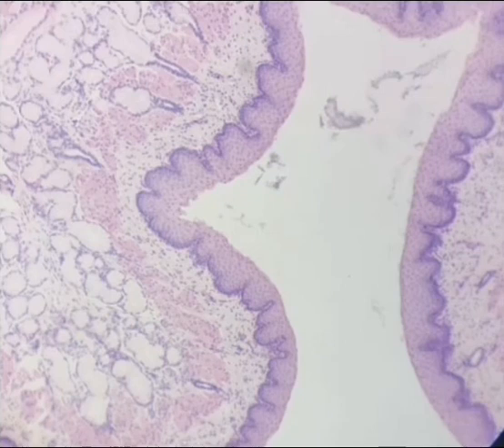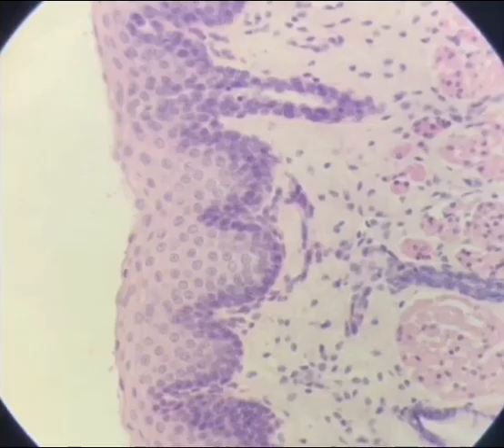This is a 10x picture, a bit clearer. The epithelium, stratified squamous non-keratinized, lamina propria, muscularis mucosa, and this is submucosa. So you can see the glands are there in the submucosa, right? Much clearer in this picture. Let's move toward the picture at 40x. So now you can see that the epithelium is stratified squamous non-keratinized, right? The upper flat cells are stratified squamous. Stratified means that it does have many layers, right? So stratified squamous non-keratinized epithelium, lamina propria, and these are the muscles of the muscularis mucosa, a bit shown there because it is a much zoomed picture.